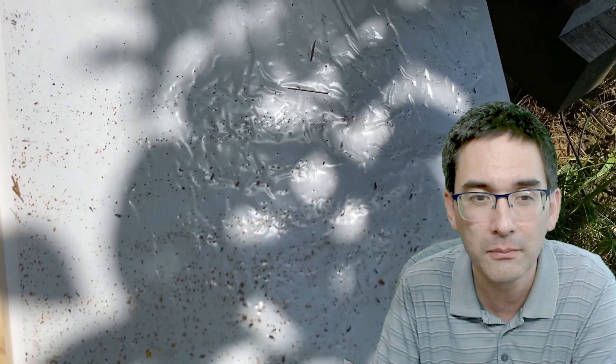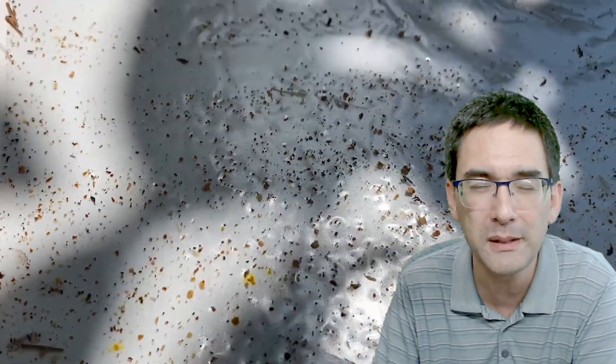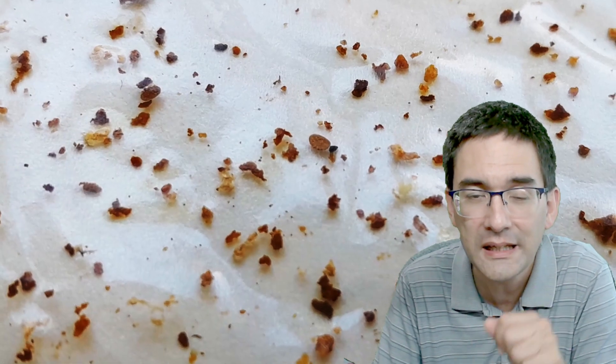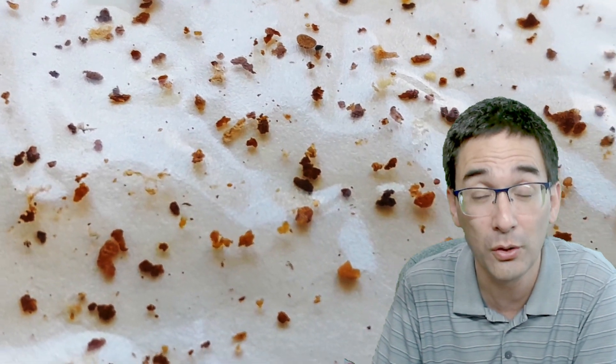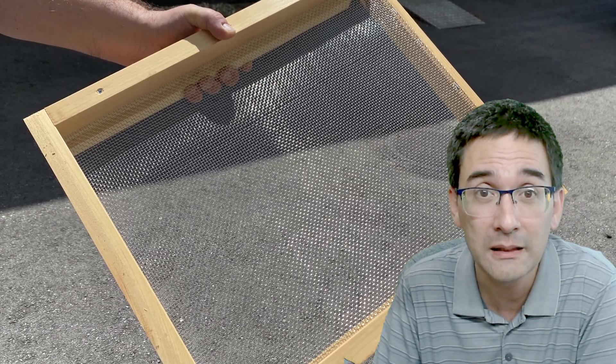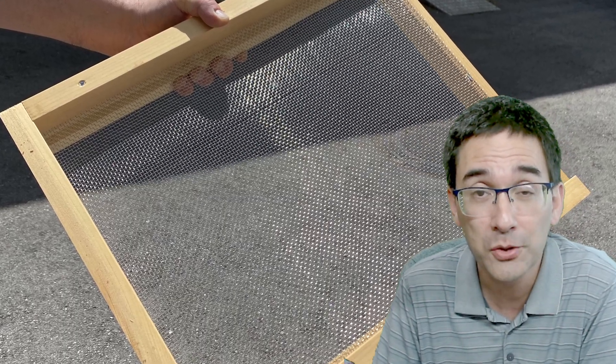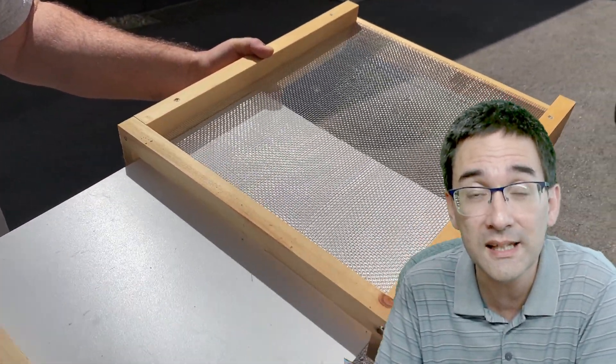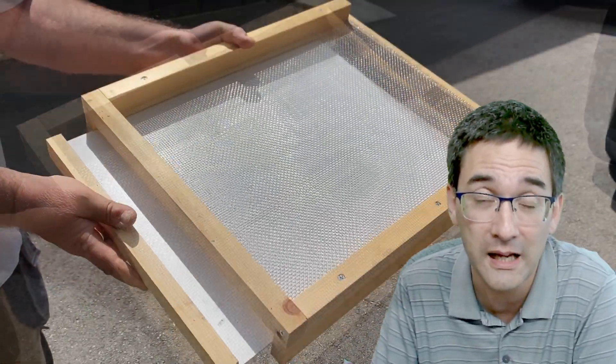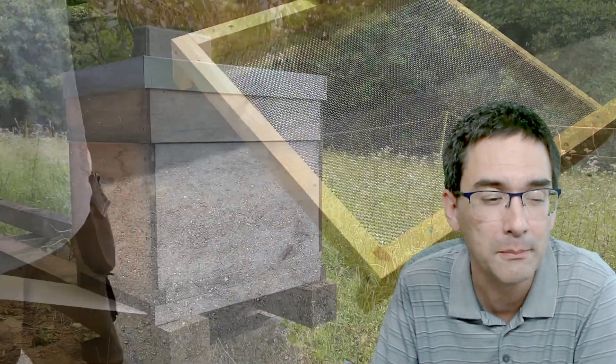You can see a lot of debris and basically parts of bees, some honey maybe, or some wax, and things that fell down inside the beehive. There were lots of particles and also of course some of the mites that fell down. Maybe some of them are dead, or some maybe are alive and fell down. Then they can be collected, and bee farmers will count the number of mites to assess how many mites are present in the beehive.